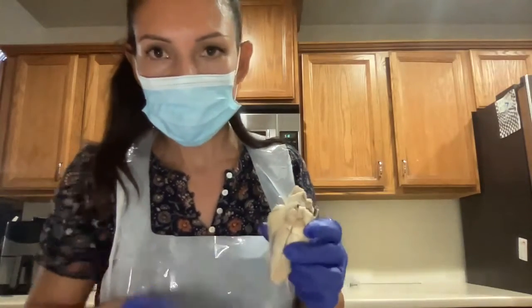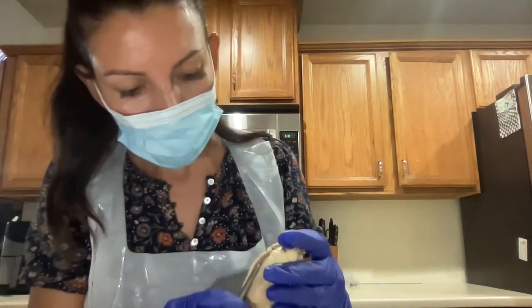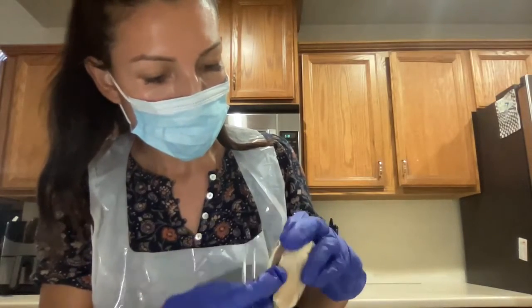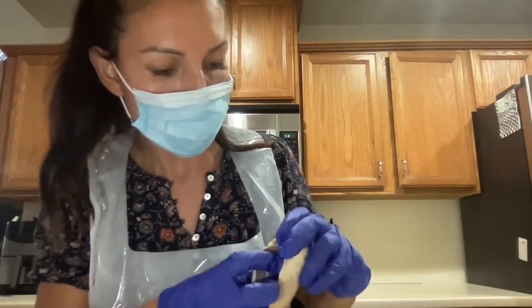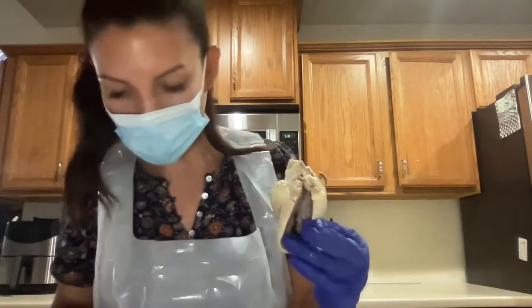Okay, so I have additional lighting. I really hope that this is clear. All right, so let's see, maybe if I use this to open. Okay, all right.